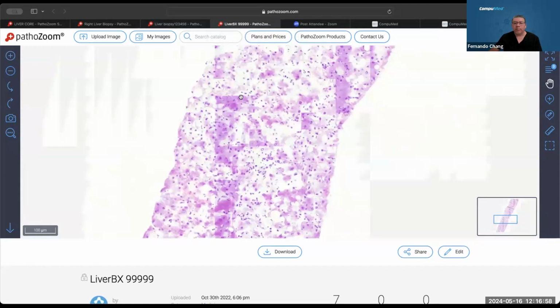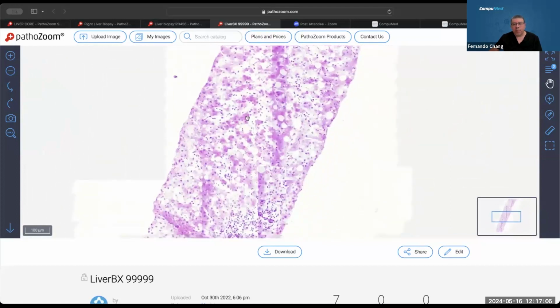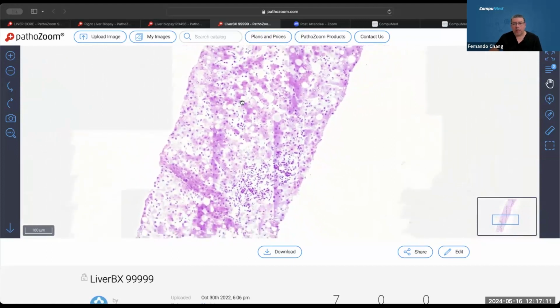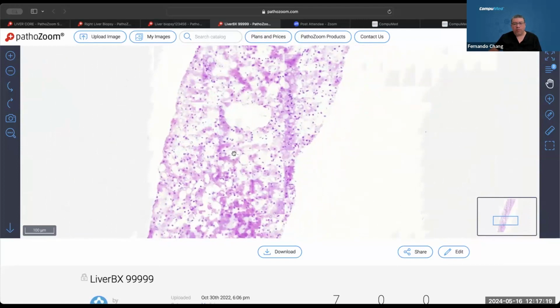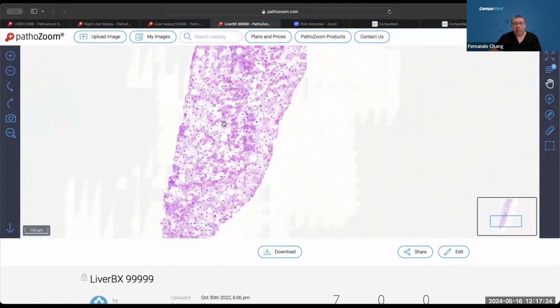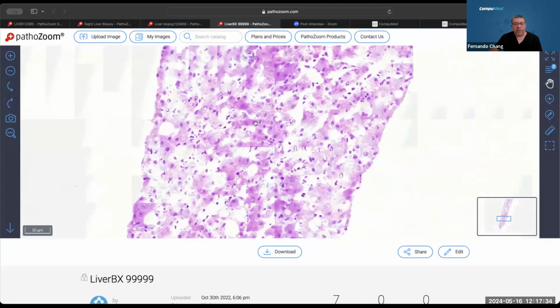I have another one here. And in this case, there's a little bit of pixelation, but most people in pathology will say, okay, this looks like it's even necrotic, but it's not. It's a combination of freezing artifact, vacuolization, a lot of compression, and bubbling as well. And all of that ended up giving a poor staining on the section, making this basically unreadable.